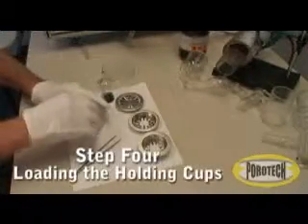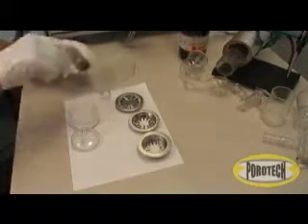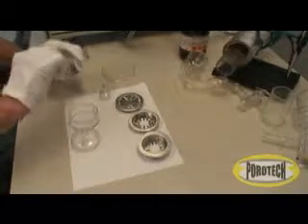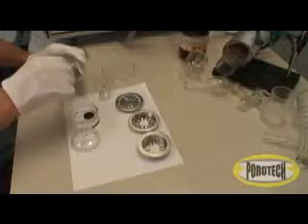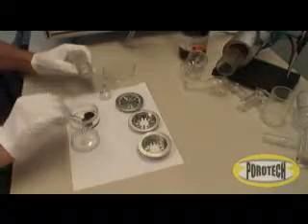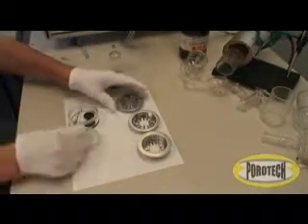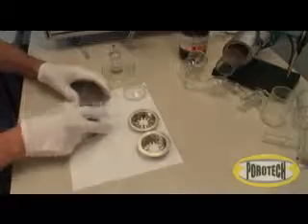Step 4. Loading the holding cups. The method of standard porosimetry, or contact porosimetry, is based on having two porous reference standard bodies, for which the pore structure is well known. The two reference standards need to come into contact with the sample being tested in order to reach capillary equilibrium.